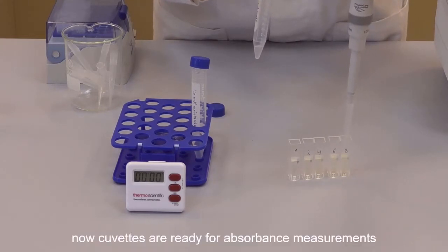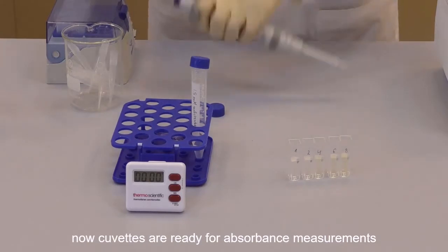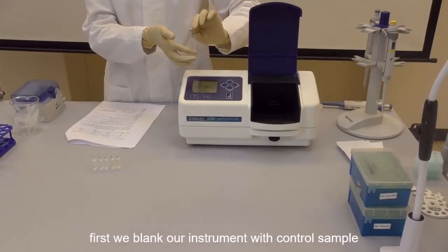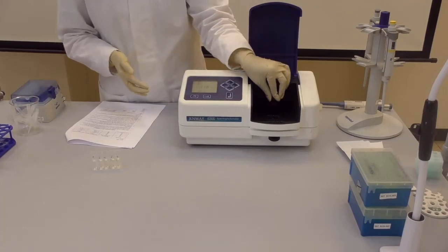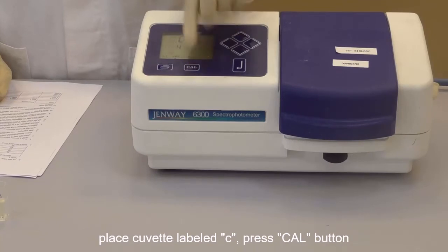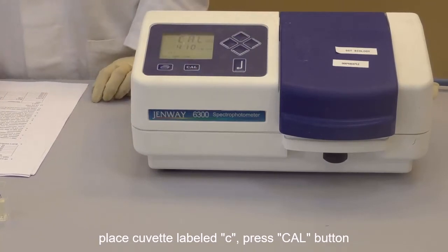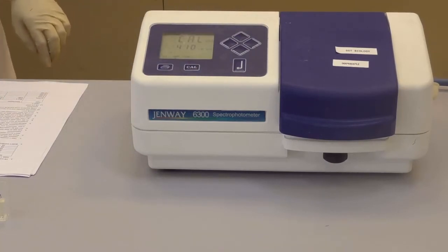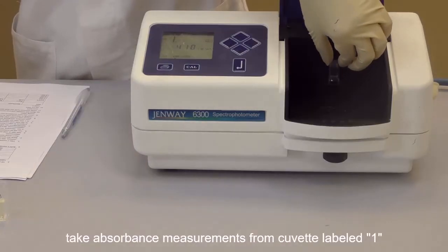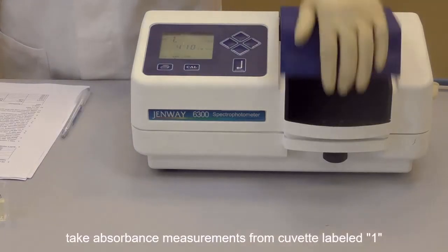Now all cuvettes are ready and we start the absorbance measurement. First we are going to blank our instrument with the control sample labeled C. By placing the cuvette and pressing the calibration button, we are going to zero the measurement. Now take the absorbance measurement from the cuvette labeled 1.